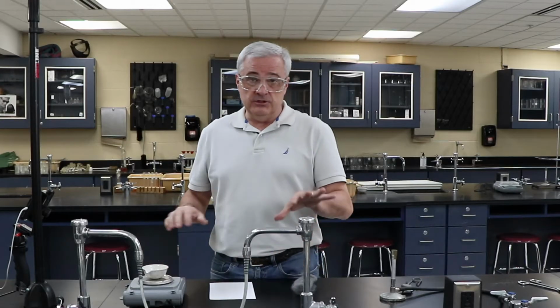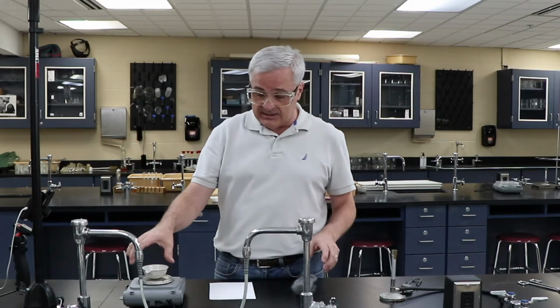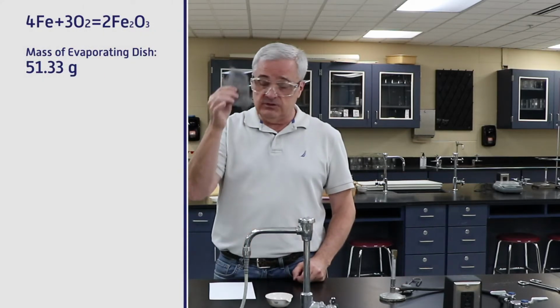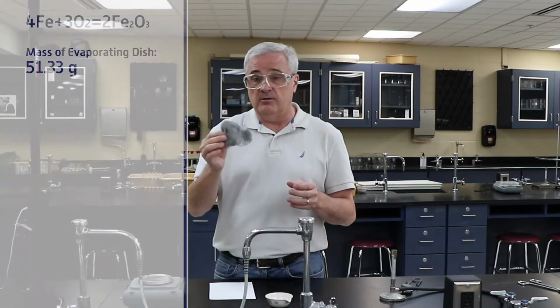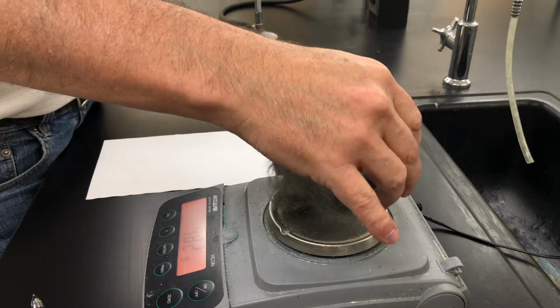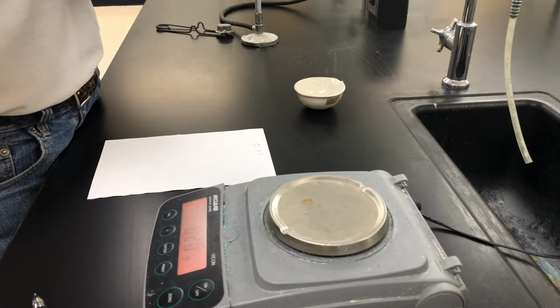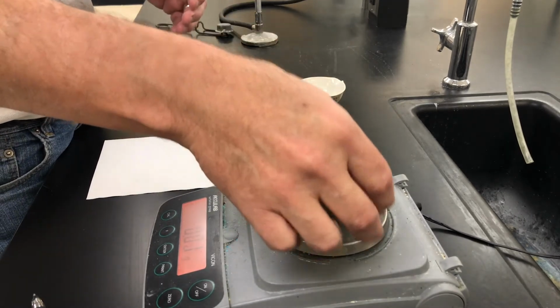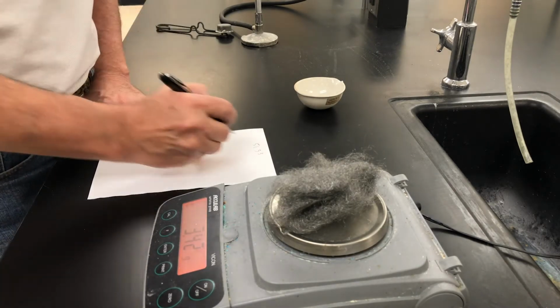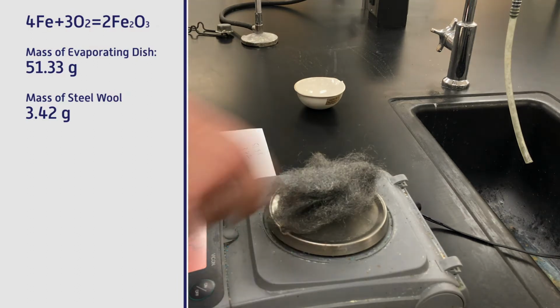If you're doing this in class, you're going to have to find a clean evaporating dish and find the mass of it. Write that down. Then we're going to get a sample of the steel wool. Acquire that from whoever is facilitating your lab, and put that on the scale, trying to get all of it on the scale so it's not partially supporting itself. And I am coming up with 3.42 in this setup.